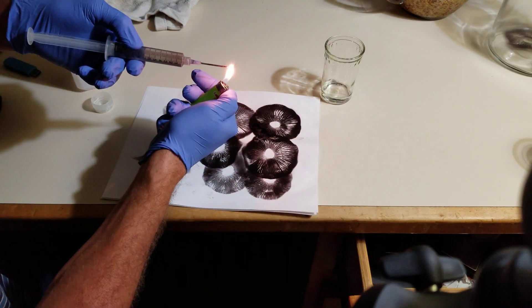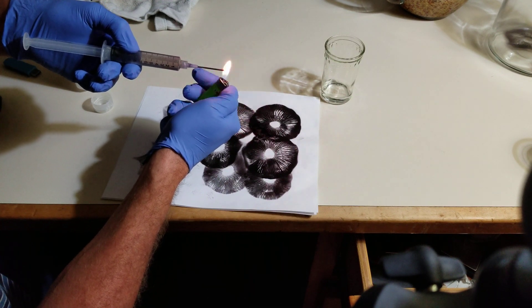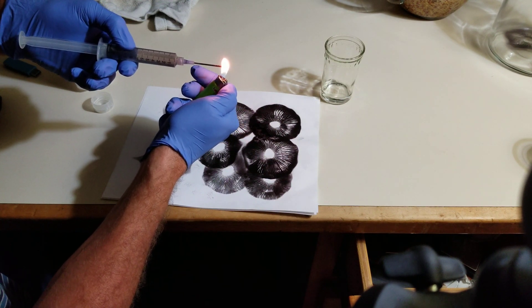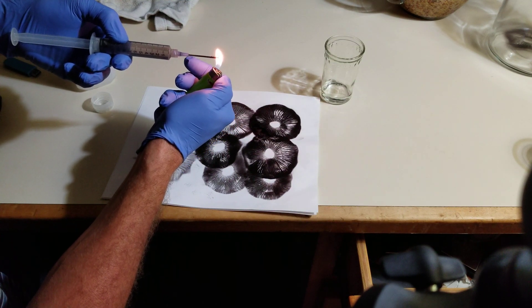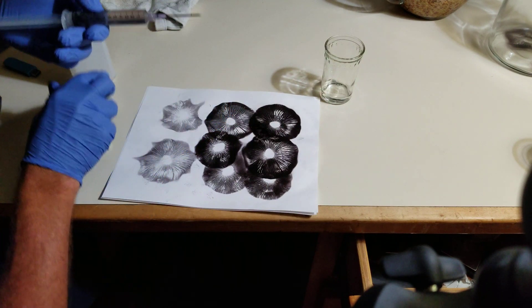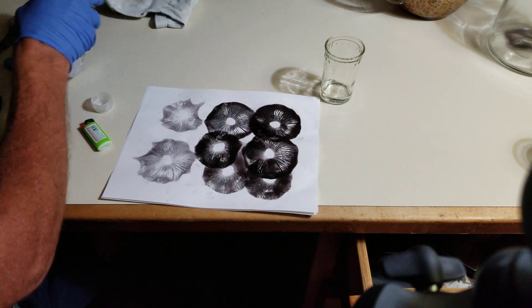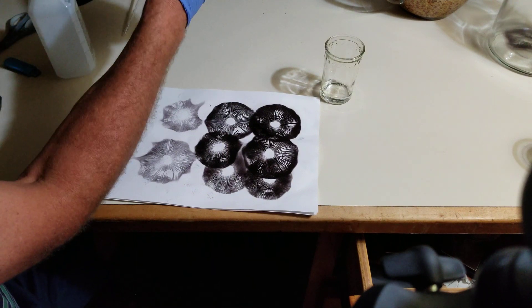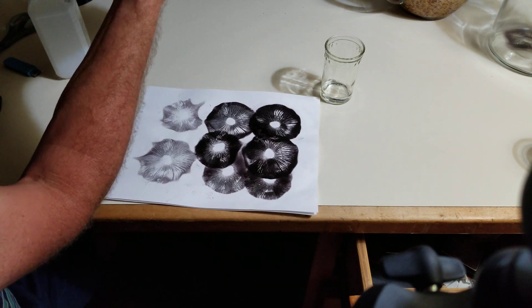I like to sterilize one more time. I actually use alcohol and I'll rub the tip. It's going to be sterilized again before use — that's one reason you would do that.